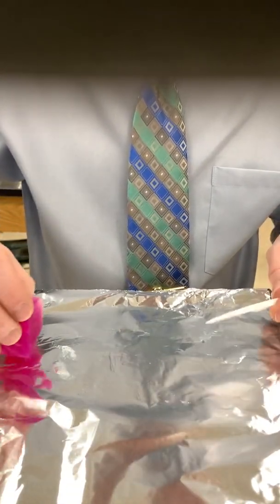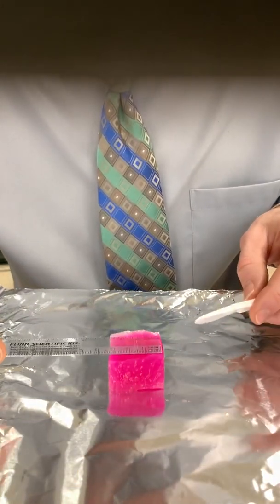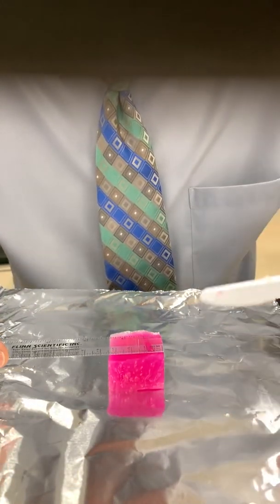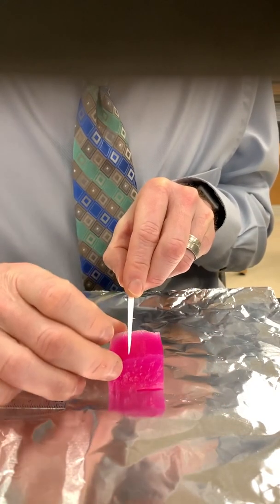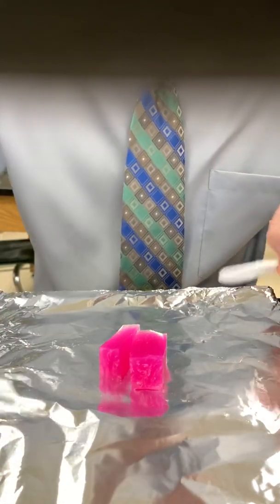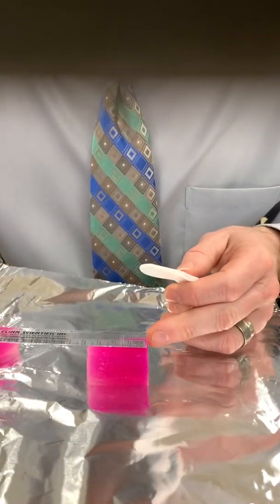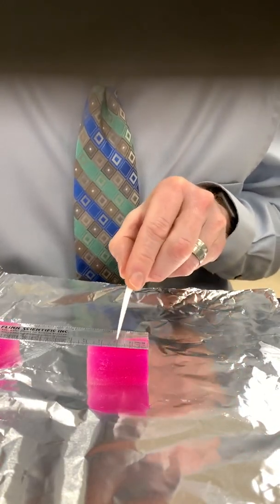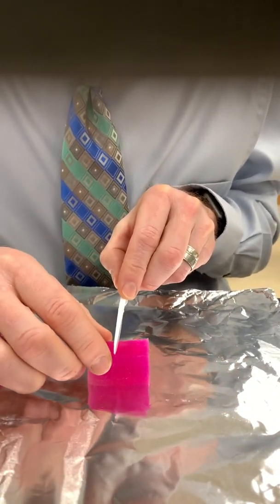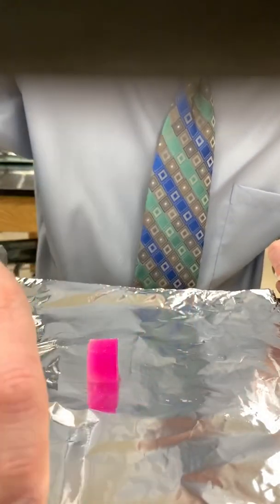Now we need the 2x2x2 cube. That's our 2x2x2.